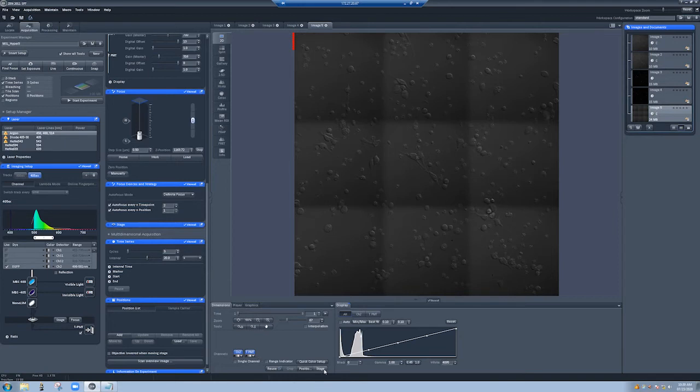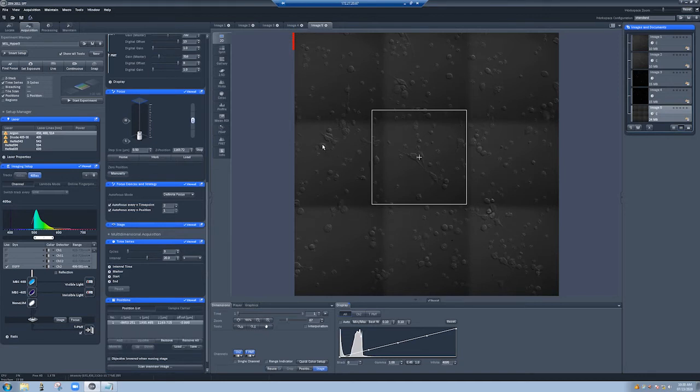But since I have this, let me take advantage of that option to show you how to add positions. If I click stage, this shows me where I am currently with the stage in my sample. So I can say, I want to center here and I want that to be position number one. And then I want this to be right here, position number two. And then I want this down here to be position number three. That's actually not the most efficient way because I'm here, then here, then here, instead of going in one order. So what I can do is move this. This becomes the first position, then we go here and here, which is a more efficient travel. So the stage will take an image here, then here, then here, which makes more sense.